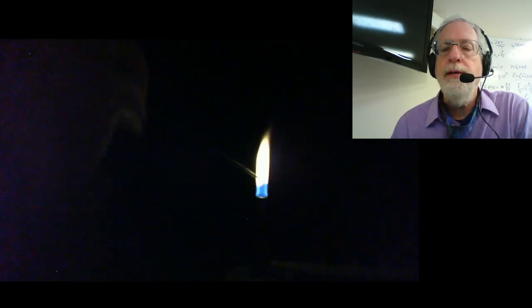But that takes us to the last part, which is an unknown. Based just on the color that you see from this, can you tell me what this unknown is? This is your unknown. And I can tell you that the solution was clear. I'm going to do it again there. You get a really nice bright flame. Now one of our solutions had a bright flame like that, and you can go back and look again, but try to identify what this is.